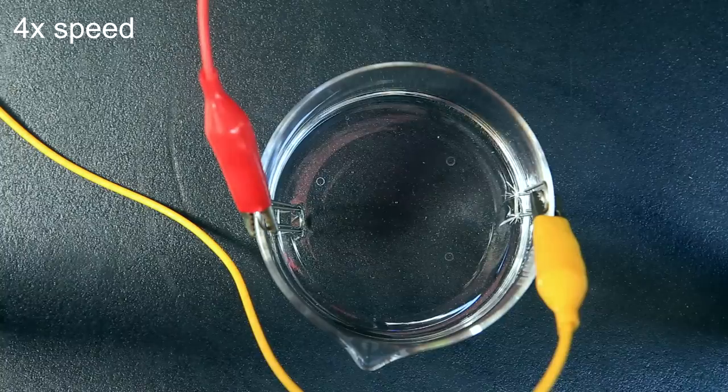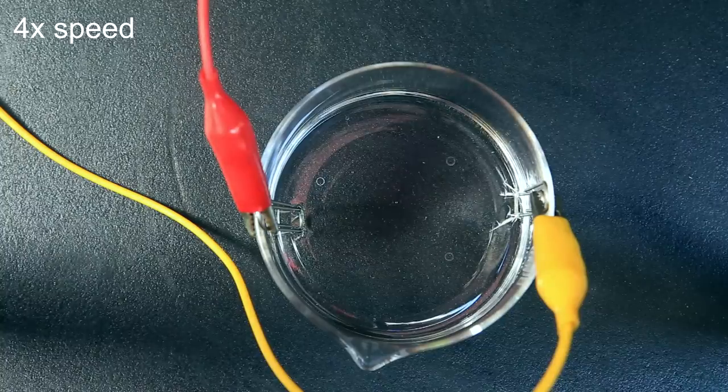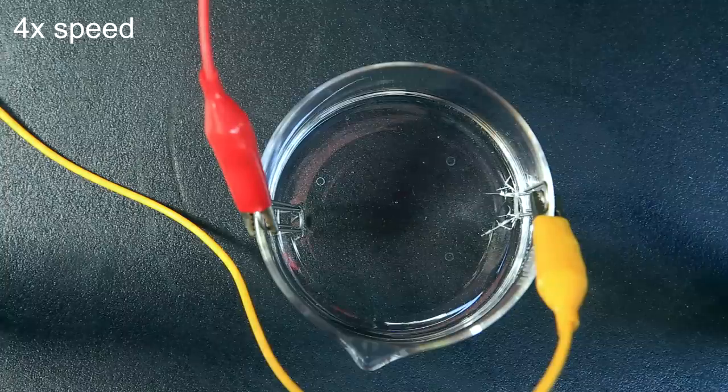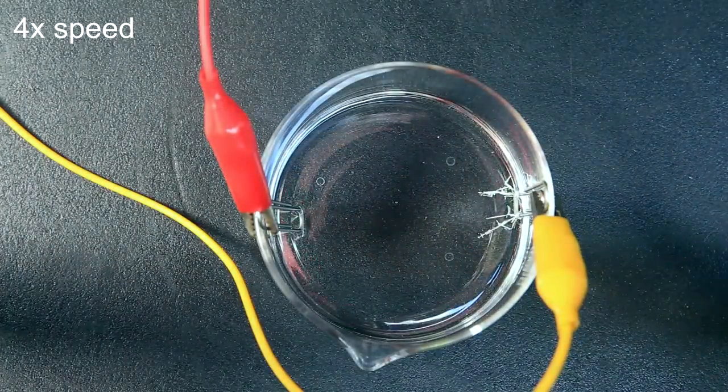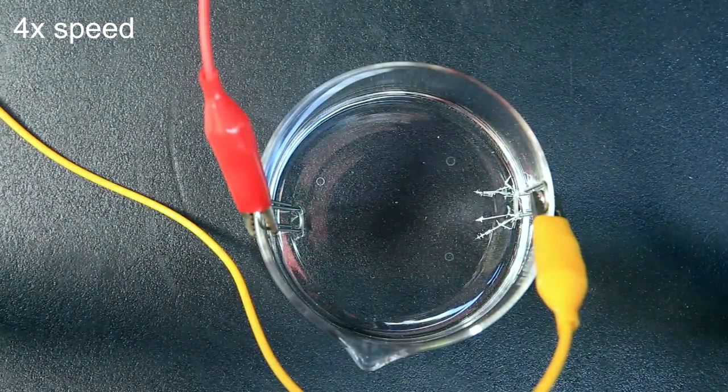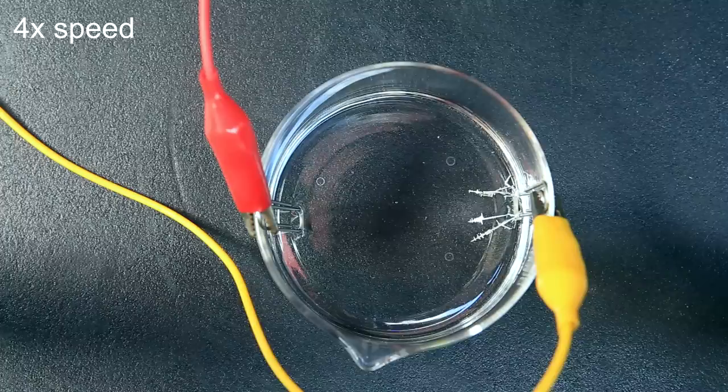The crystals will grow from whichever alligator clip was attached to the negative terminal. So after it was attached, we can see the crystals starting to grow. It was very interesting for me to see this the first time, but I was honestly quite underwhelmed at how slow it was and how few crystals were growing.